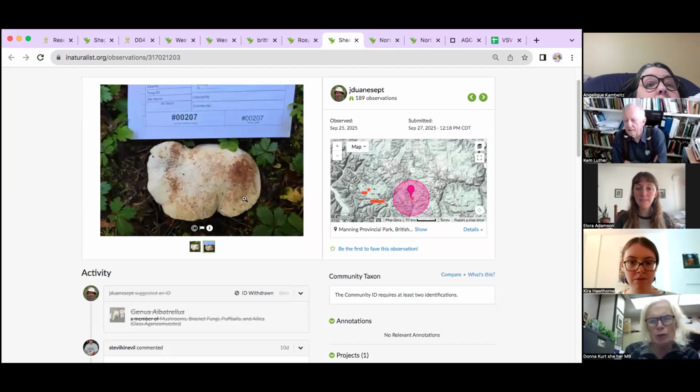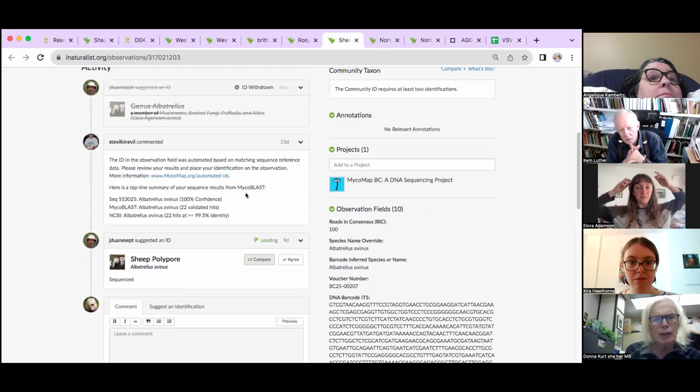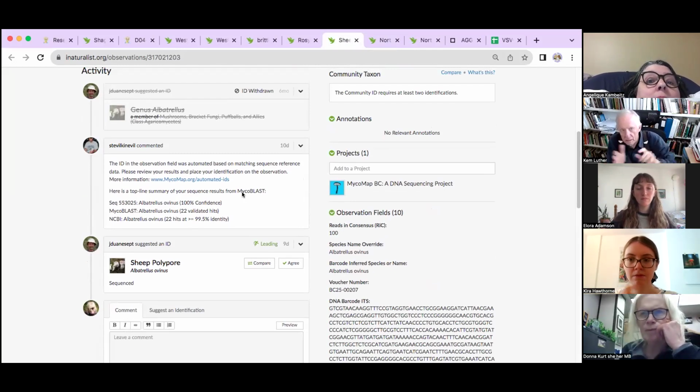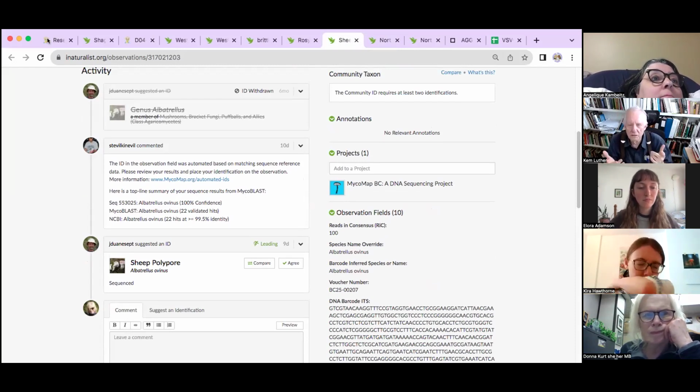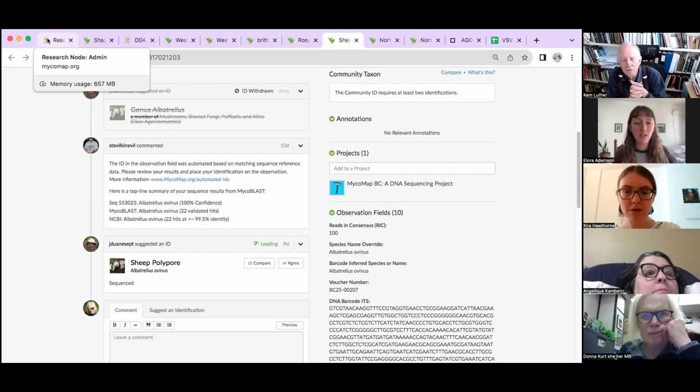Laura, one thing that would be nice to have, just a couple things. When we go on the mycomap.org site, we have to find the query box to put in the INAT number. That query box, sometimes my eyes have trouble locating it. If it could be somehow enhanced so we go right to that, because that's the most common place we go to. When using the spreadsheet, yeah, but when we're not using the spreadsheet, I think we'll almost never use that box.